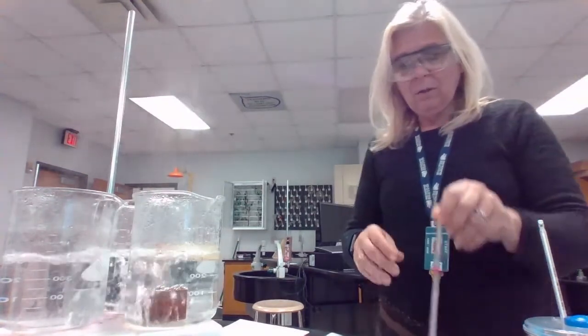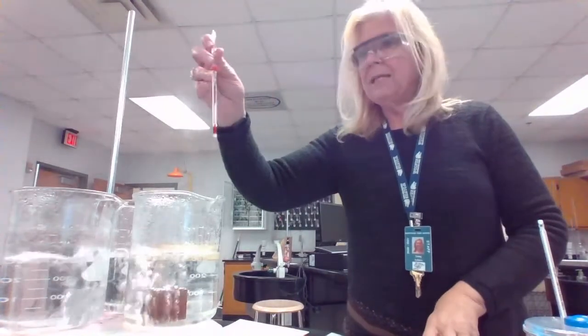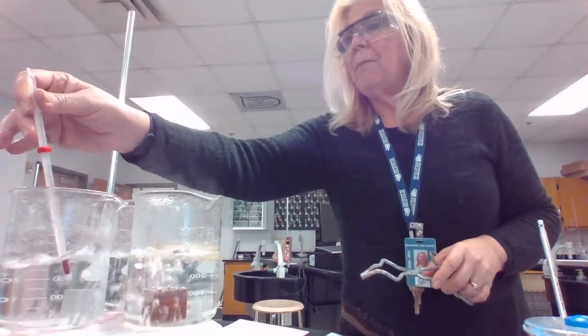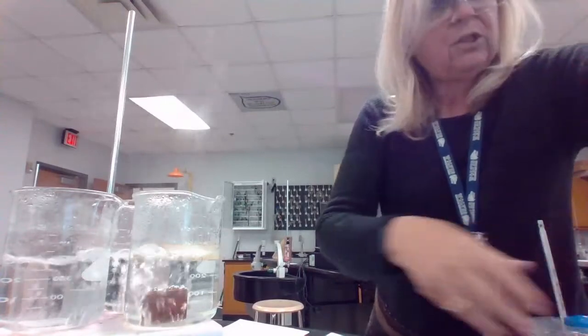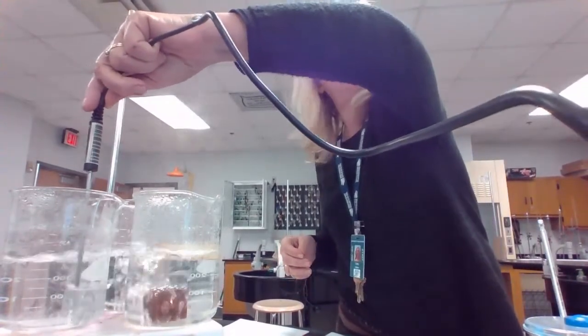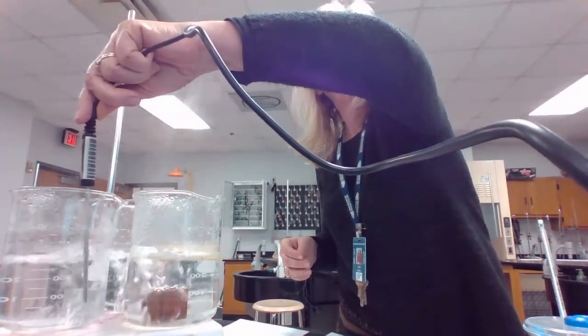Okay, so I'm about to move things now, and I want to know what aluminum's highest temperature is. That is the starting temperature for the aluminum. I really want to use the temperature probe because it is so much easier. So the starting temperature of the aluminum is, and it's going up, it'll tell us in just a second.